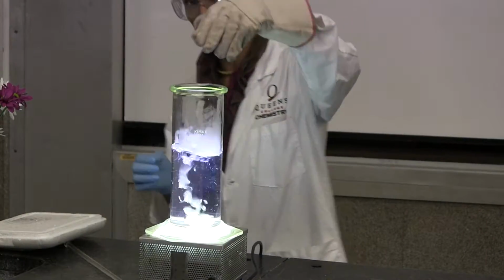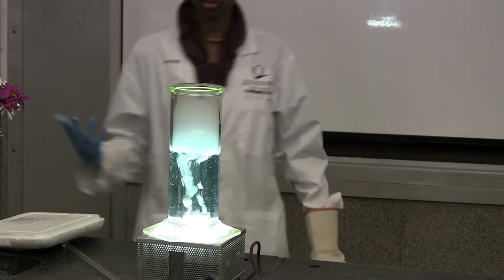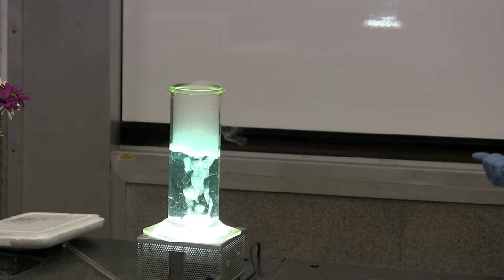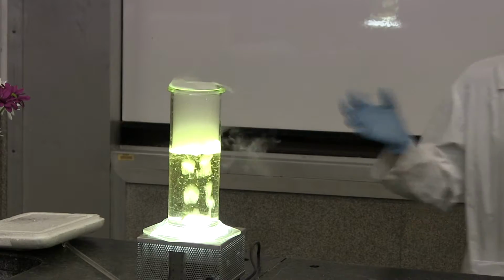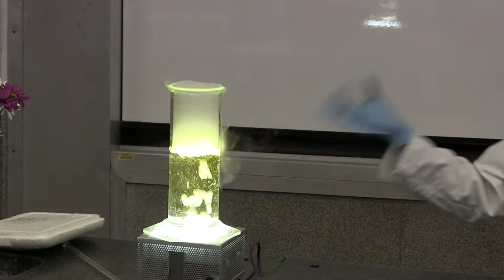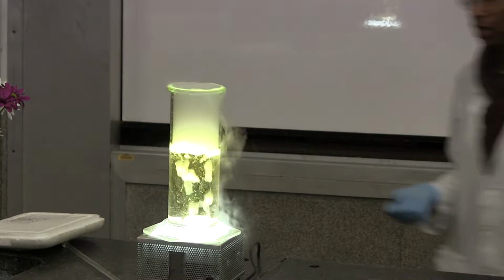Let's see what happens. Even though CO2 is solid, it's solid dry ice, when it dissolves in water, it produces an acid called carbonic acid. So you can see the color change here, right? We have an acid, and it's going through different colors. Green is neutral, pH 7, it goes to yellow. Now this is acidic. So the CO2 is dissolving and producing the acid, carbonic acid. So we have this nice yellow color here.